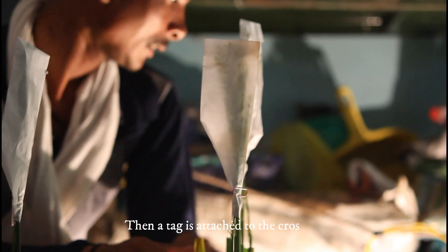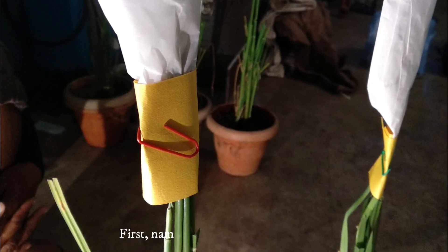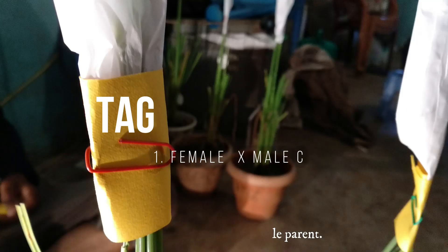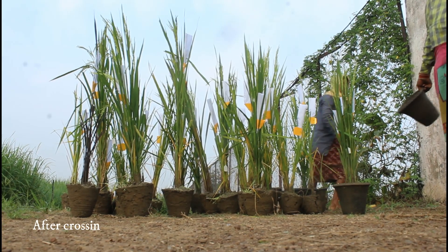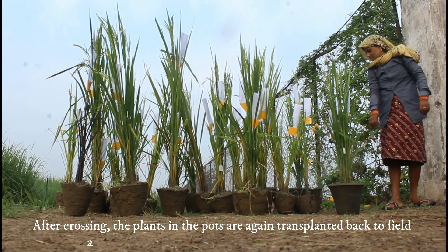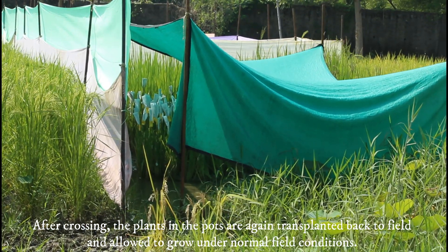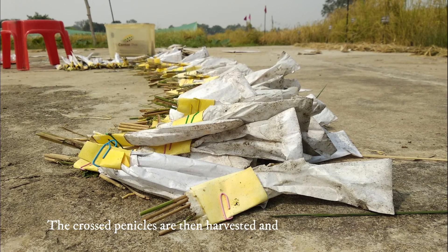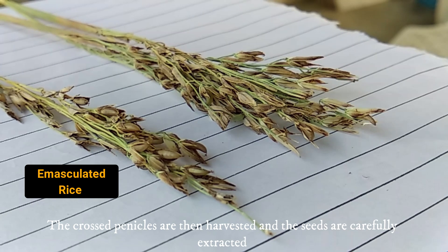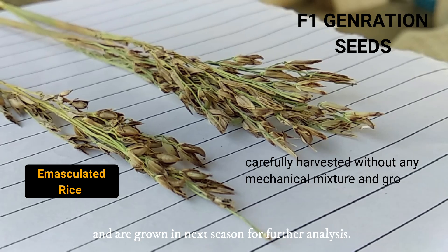A tag is attached to the crossed female plant which consists of the name of the female and male parent, date of emasculation, and date of pollination. After crossing, the plants in the pots are transplanted back to the field and allowed to grow under normal field conditions. The crossed panicles are then harvested, and the seeds are carefully extracted and grown in the next season for further analysis.